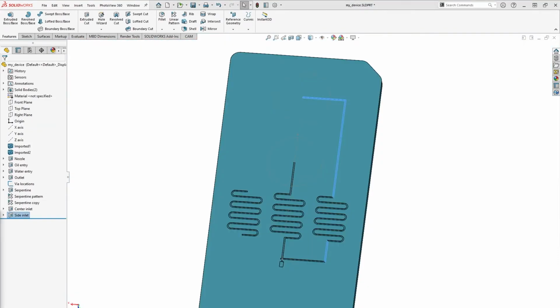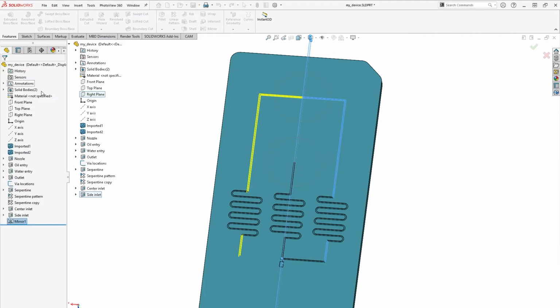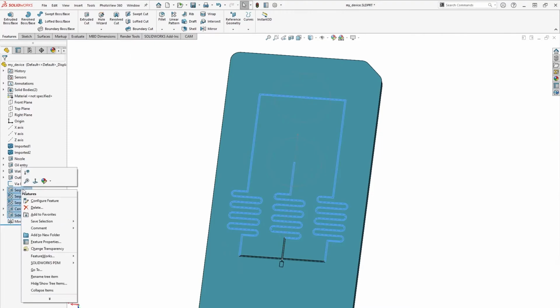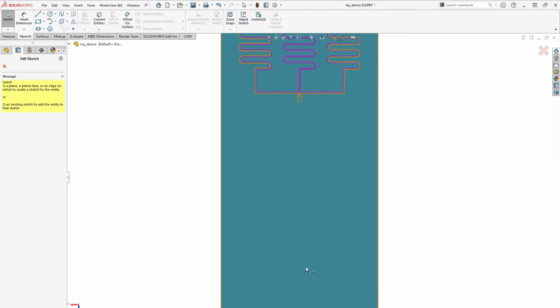Now let's mirror the last set of features about the right plane to save us a little work. We're starting to get quite a few features in the tree, so let's also dump all of the inlet features into their own folder to keep things neat. We'll use another extruded cut to connect the outlet to the bottommost via position.